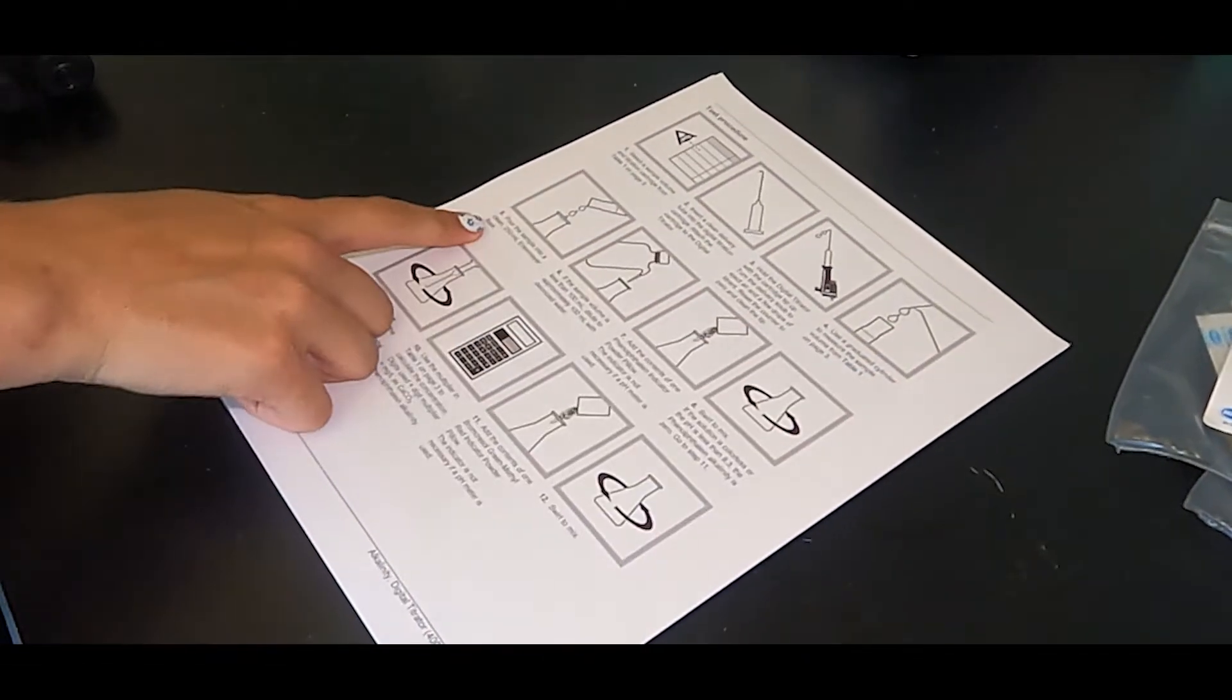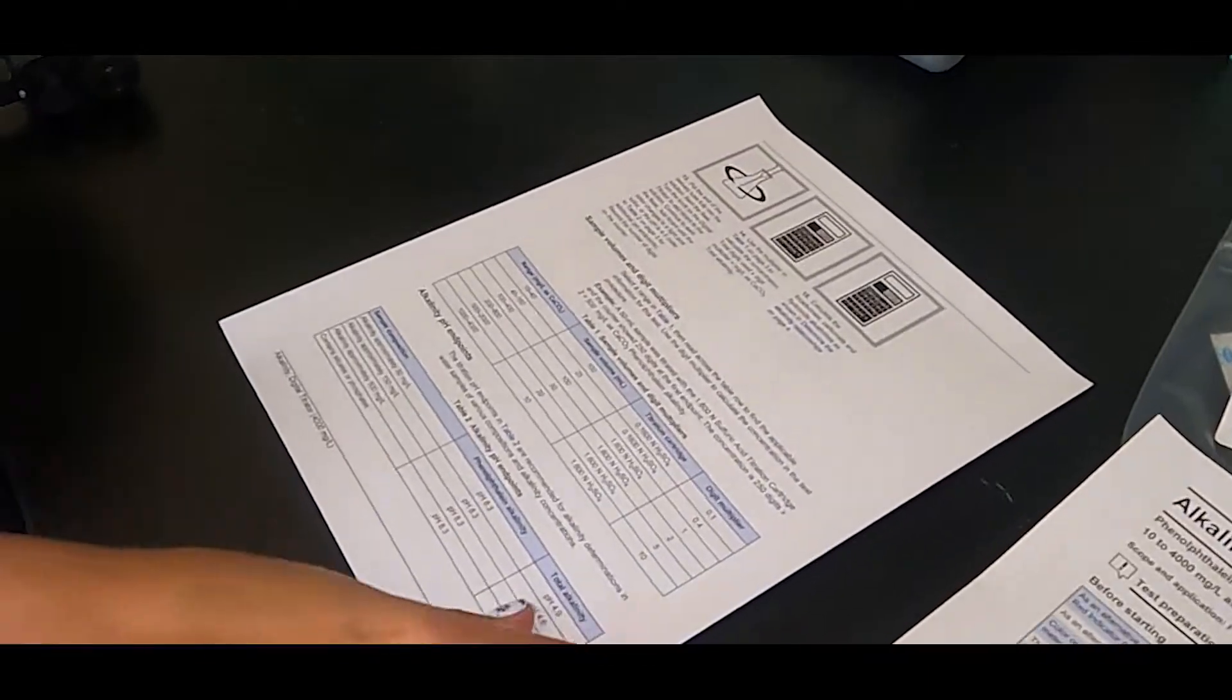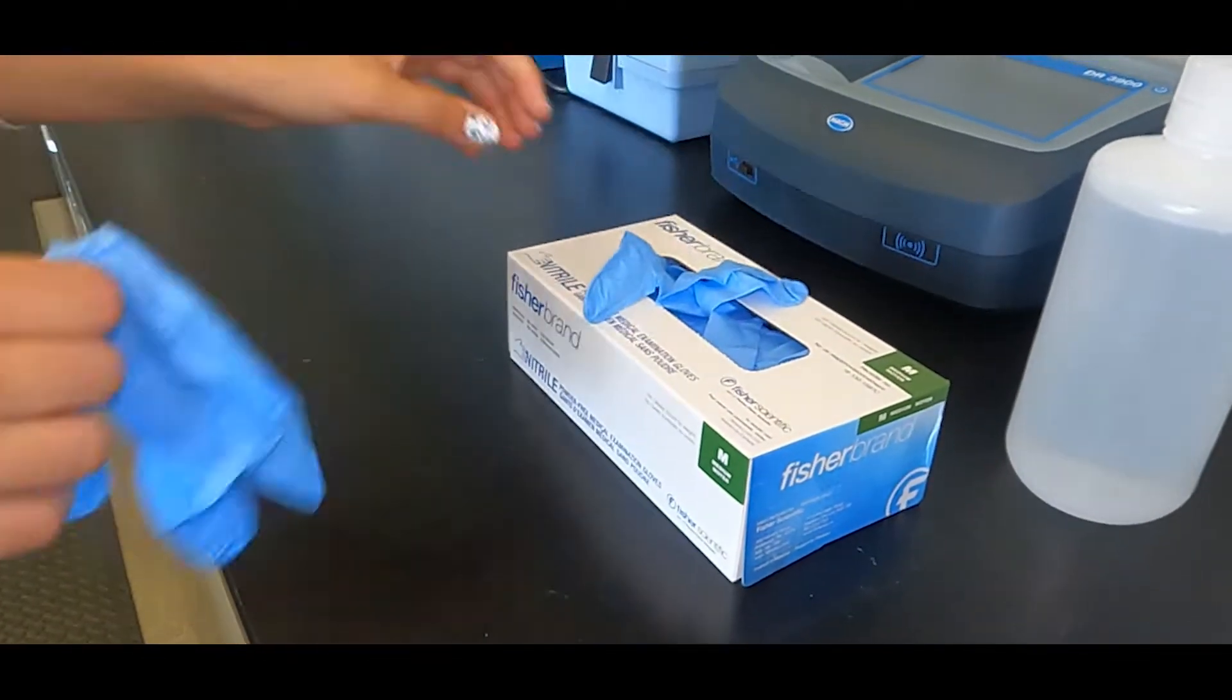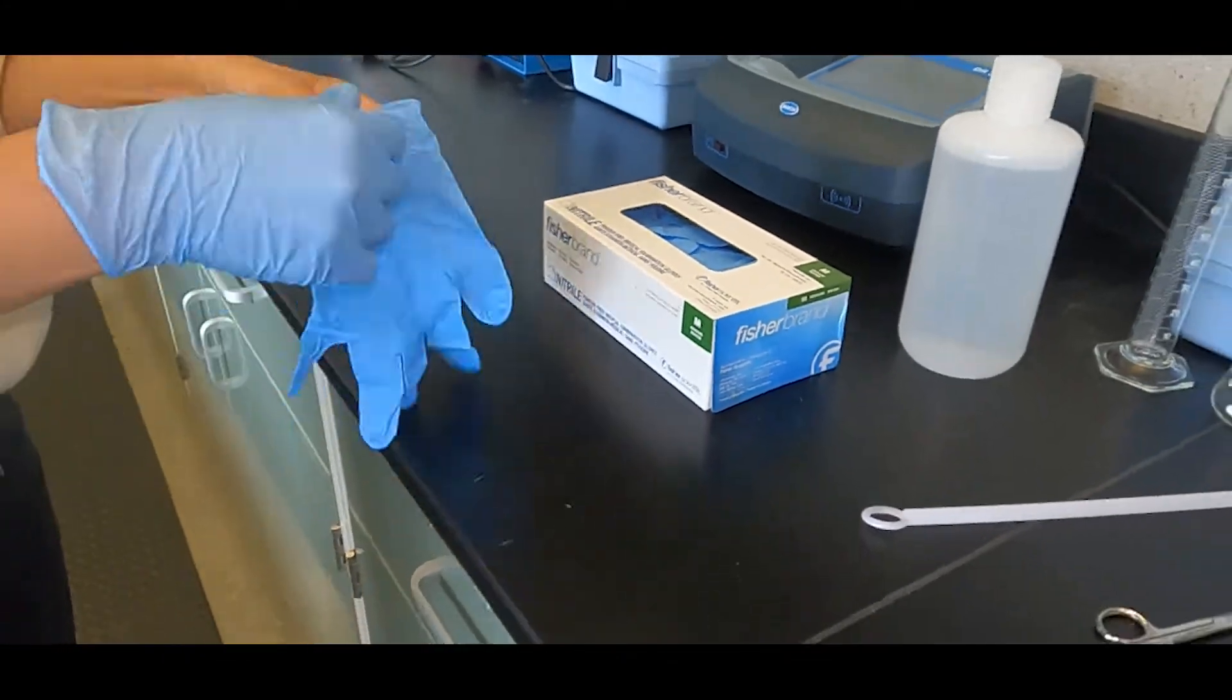This is a basic overview. You should always refer to the methods and procedures specifically provided for your equipment. It is also important to review the safety data sheets for the reagents that are used and to use any personal protective equipment that is recommended.